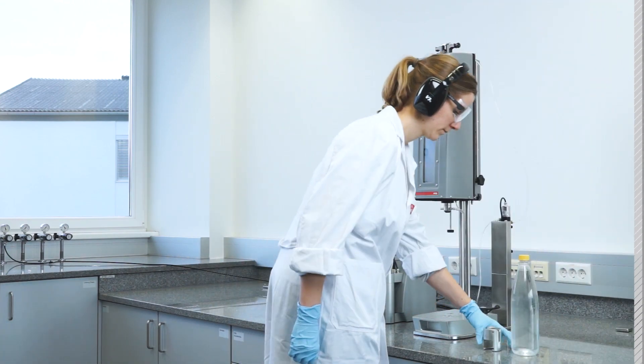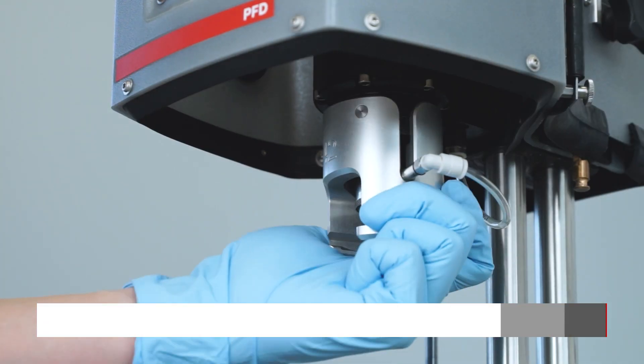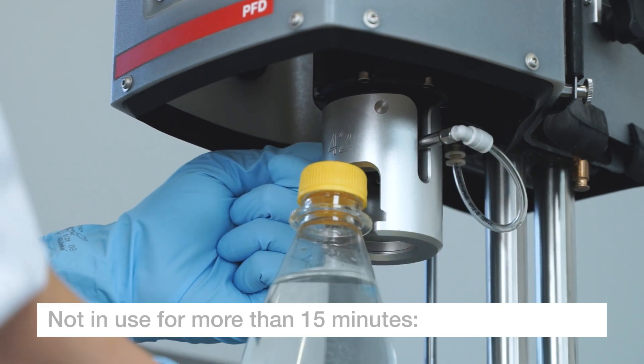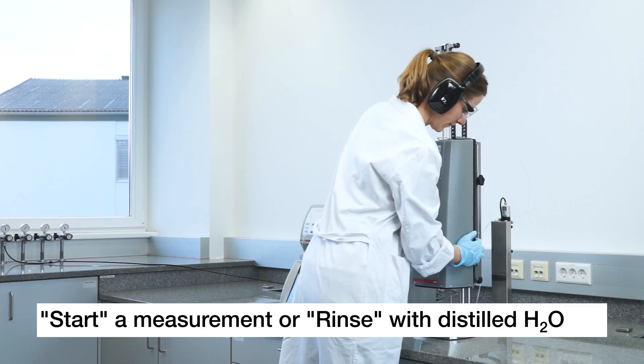In case you are not using your PBA system for more than 15 minutes, please fill distilled CO2-free water either by starting a measurement or by the utility called Rinse.